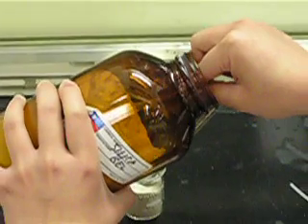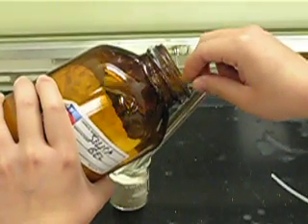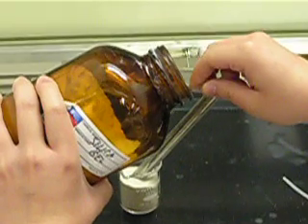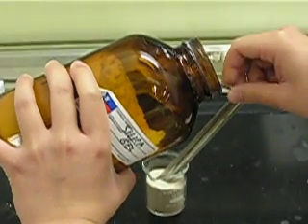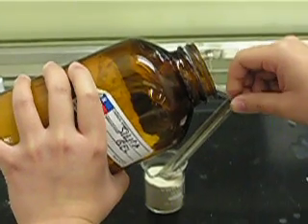You should try to stick it in and get as much silica as you can. I'm going to get about a thumb's width and start rolling your pipette like this to make sure your silica falls down. Just keep rolling it.